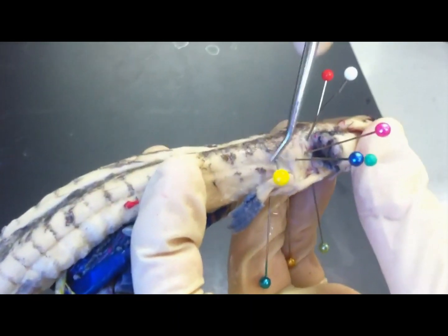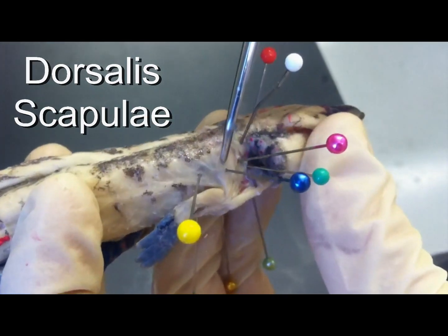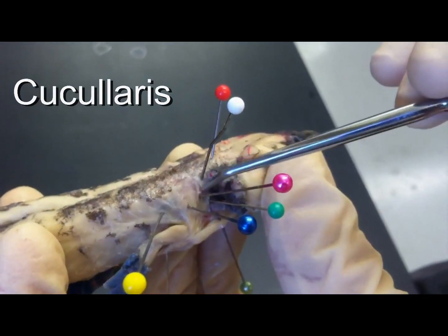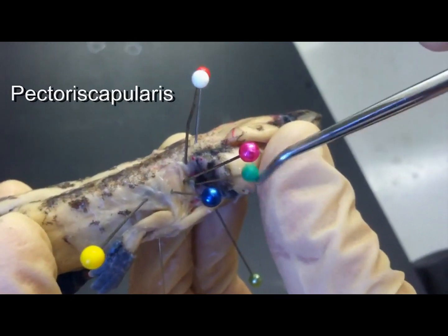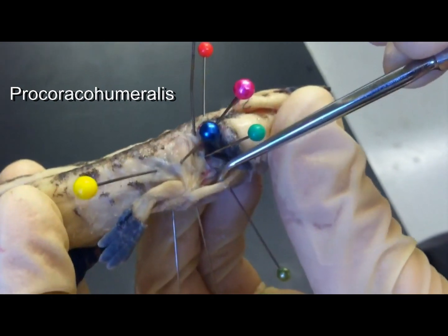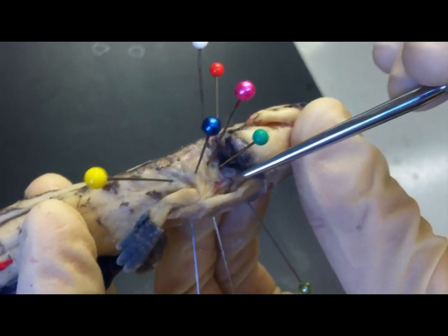Then we have a bunch of very small muscles which we've pinned. The yellow one here is the latissimus dorsi, the blue one is dorsalis scapulae, the pink one is cucullaris, the green one is pectoroscapularis, and then we have one that's not pinned which is the procoracohumeralis.